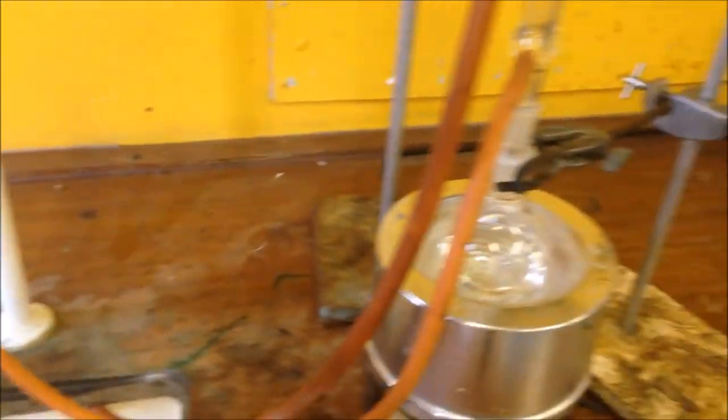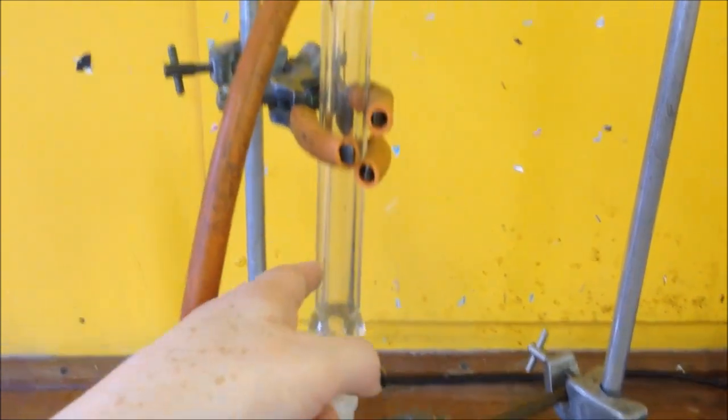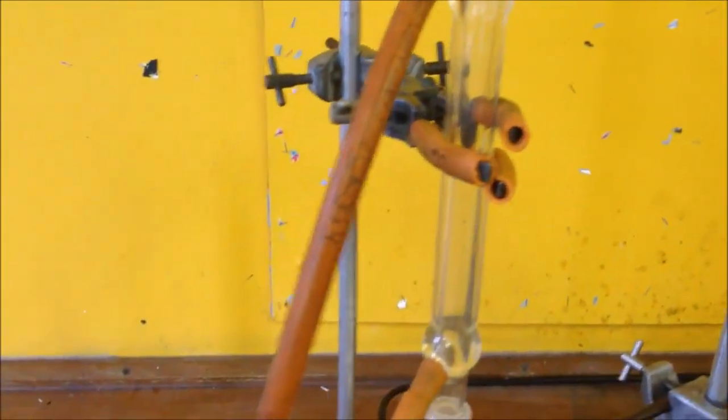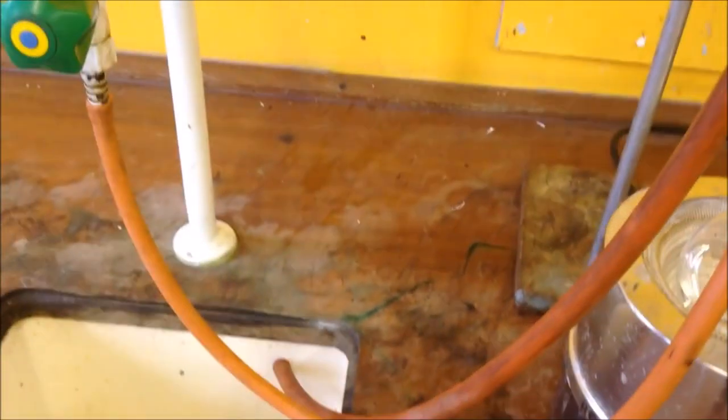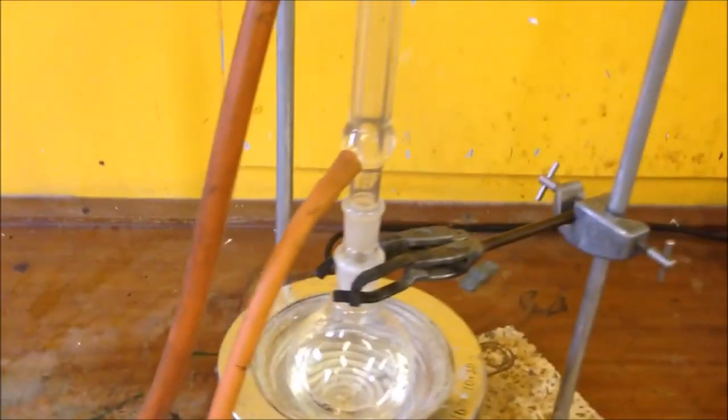The important thing to remember with reflux is that the water needs to go in at the bottom. The cold water comes in here and then the hot water, or the water that's been warmed up a little bit, needs to go out at the top.